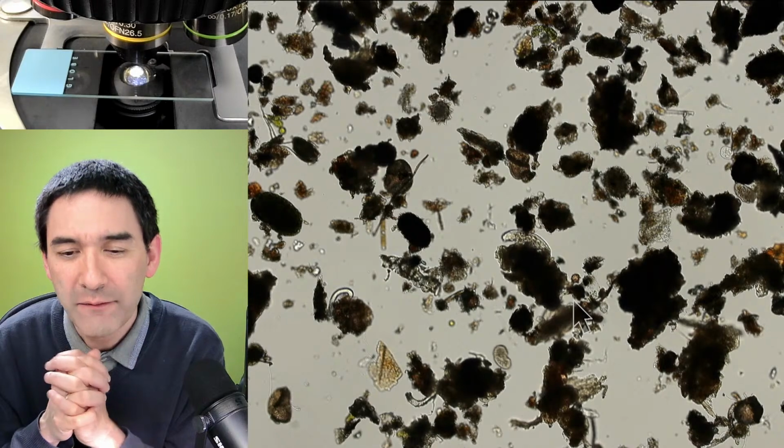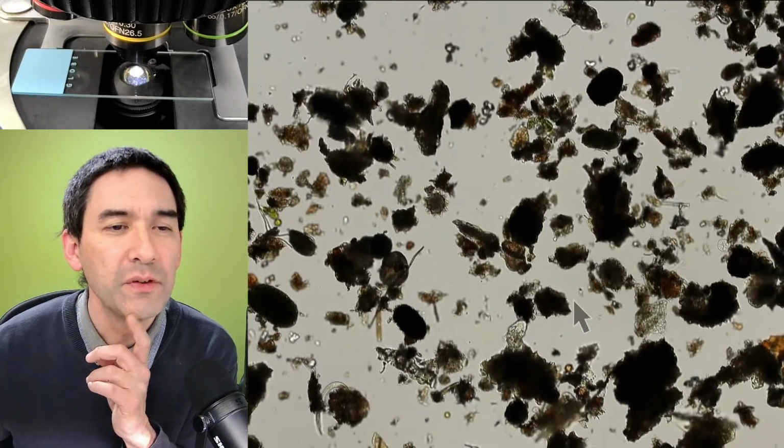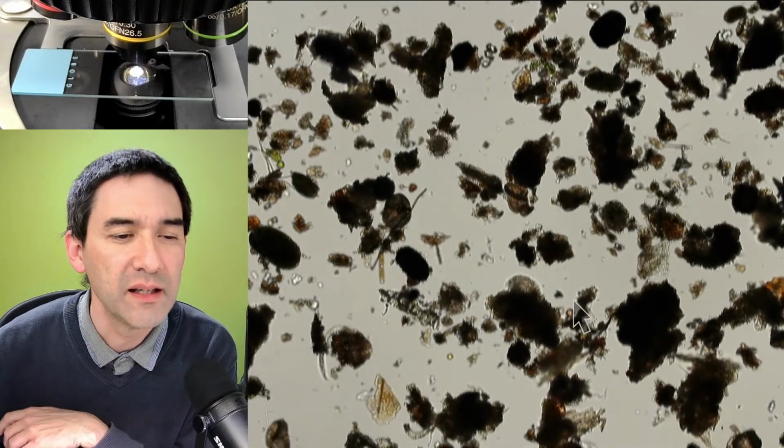Yeah, I found an interesting sun shape above. Did you see something here? If you find something that's shaped like a sun, then it's a heliozoan.